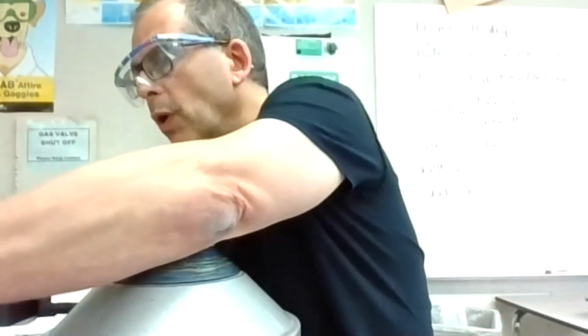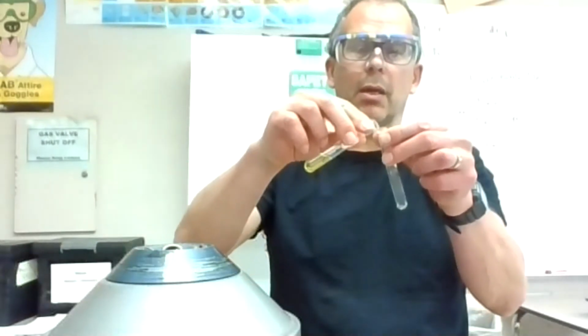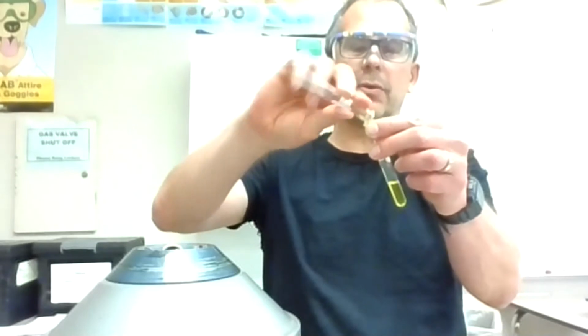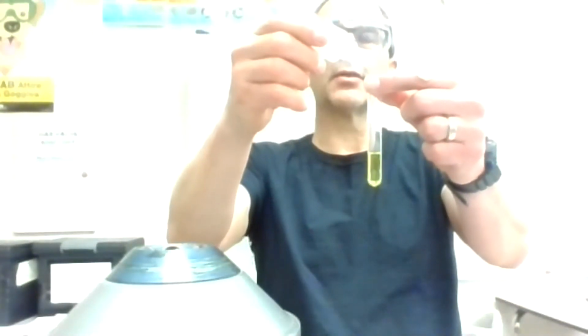Let's go to the fourth step. I'm just going to decant it, even though I probably don't need to. It's not like there's anything in there, but I'll just put it here. Then I'm going to add the CO3 minus 2. I like to look at this right when I add the drops.